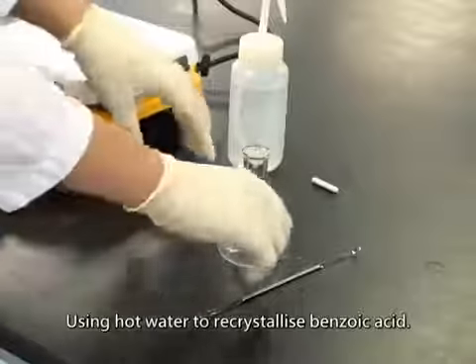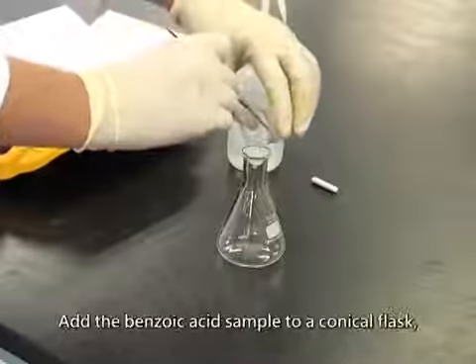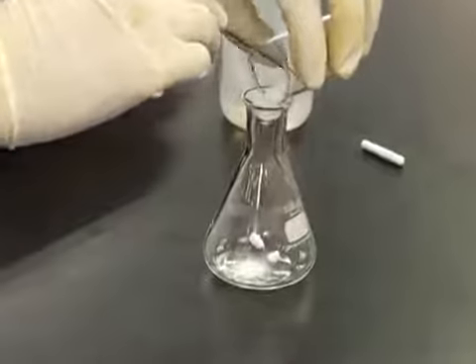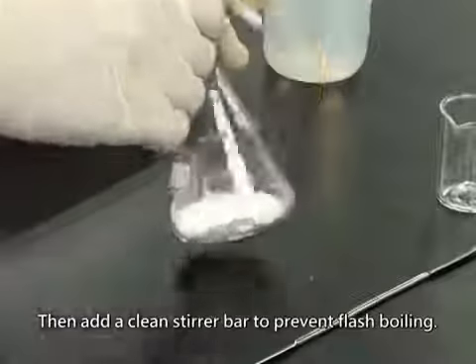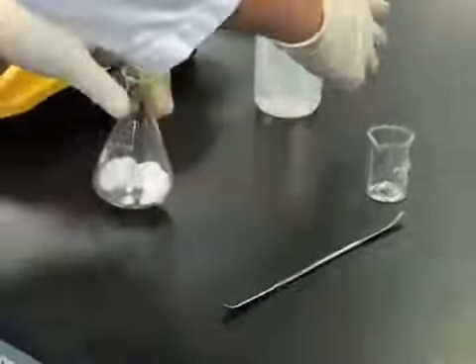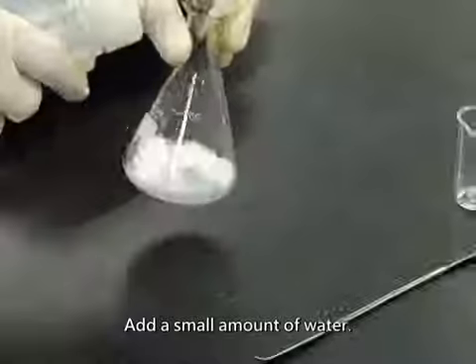Using hot water to recrystallize benzoic acid. Add the benzoic acid sample to a conical flask. Then add a clean stirrer bar to prevent flash boiling. Add a small amount of water.